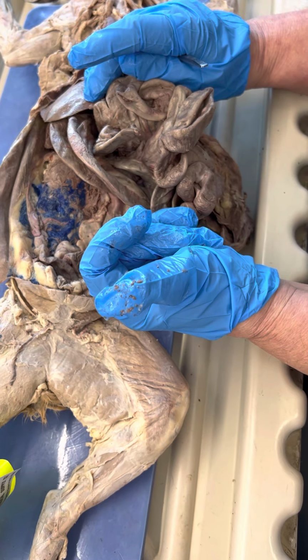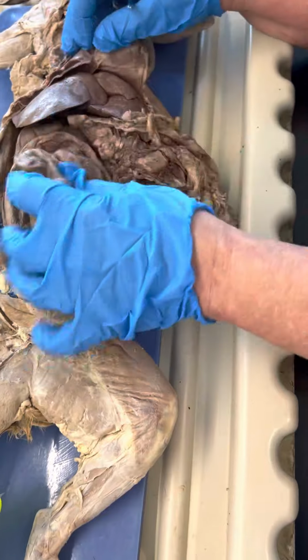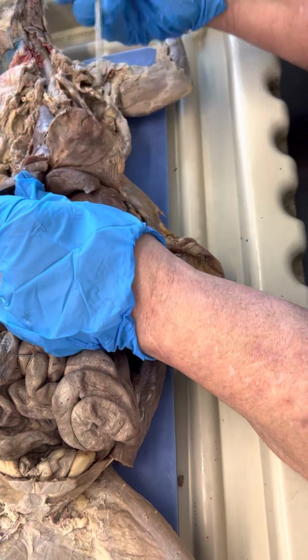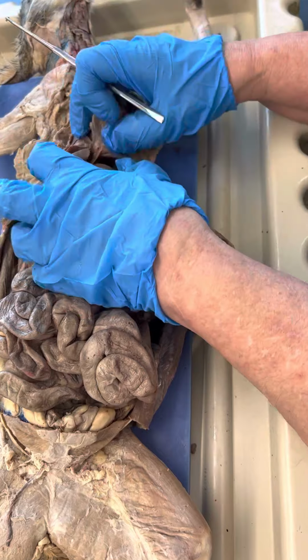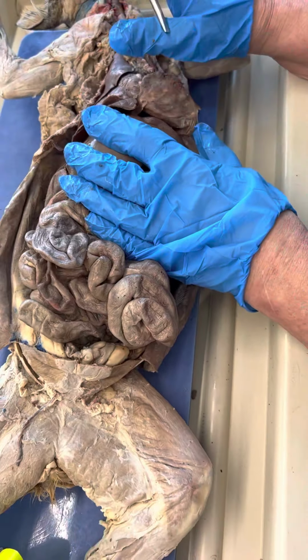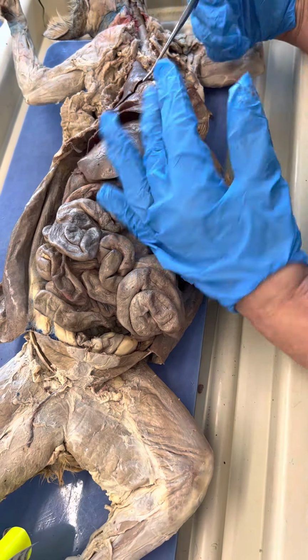You have your falciform ligament, your median ligament, your round ligament. Those are all around the liver. The falciform ligament comes down the middle and divides the liver in half. The median ligament is up here, and the round ligament is kind of hard to see. It would be on the back. In my opinion, that would be very difficult to pin. We talked about peritoneum.